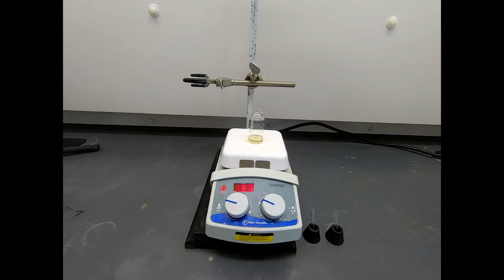However, I don't want to continue on with this reaction because I really have no visual evidence that anything has happened. I just know the procedure said to go 20 minutes. And a lot of reactions, if you just go based on the time in the reported procedure, it may or may not be complete. Now, I do a lot of reactions on the channel, and a lot of these, the reaction forms a precipitate. And so there's a visual indication it's done. But we have nothing for this reaction.